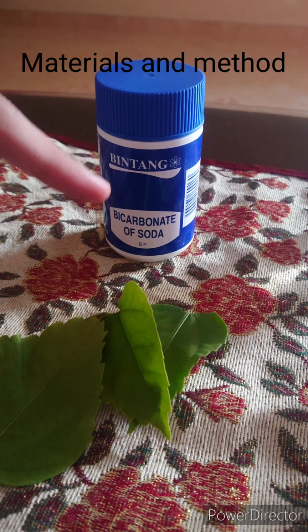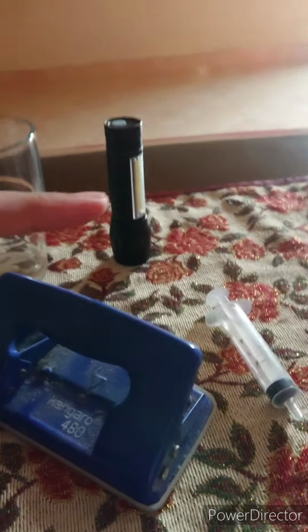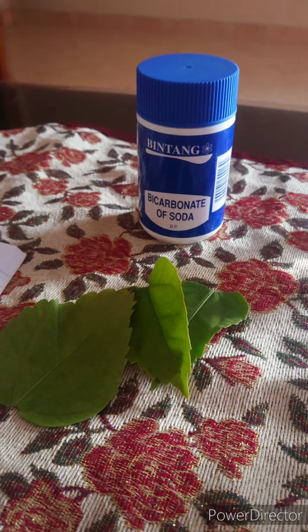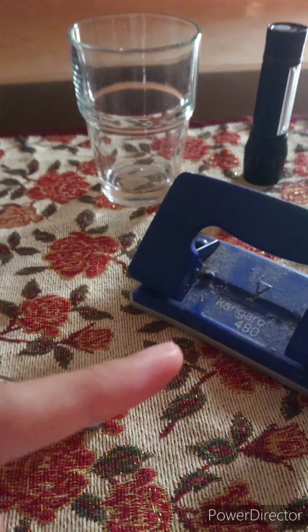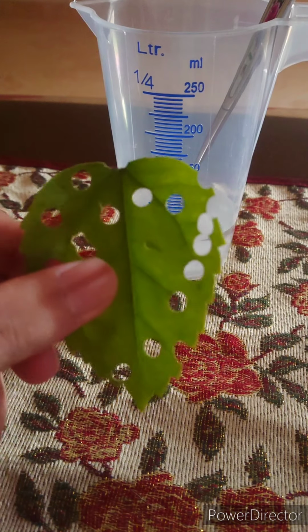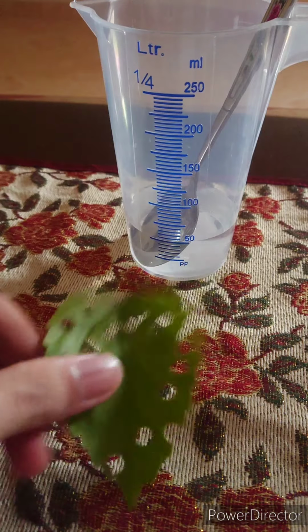I had bicarbonate of soda, a beaker with 50 ml of distilled water, another beaker, a torchlight, and some pieces of leaf. I took them from Hibiscus rosa-sinensis, which is bunga raya, the pride of Malaysia. I also had a teaspoon to take some bicarbonate of soda, a puncher to make holes in the leaf, and a syringe. The leaf has been punched, and 1/4 teaspoon of bicarbonate of soda is already in the beaker.